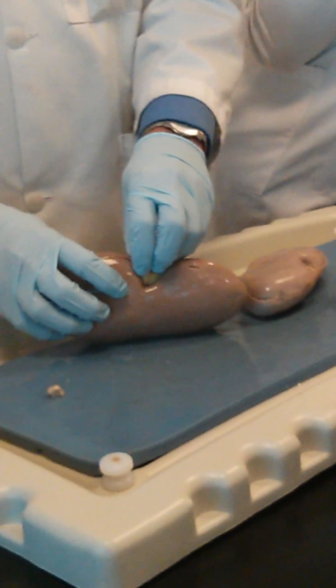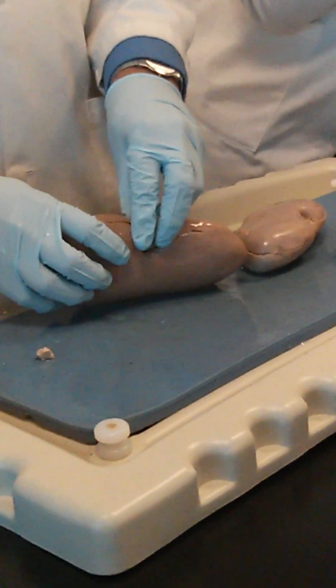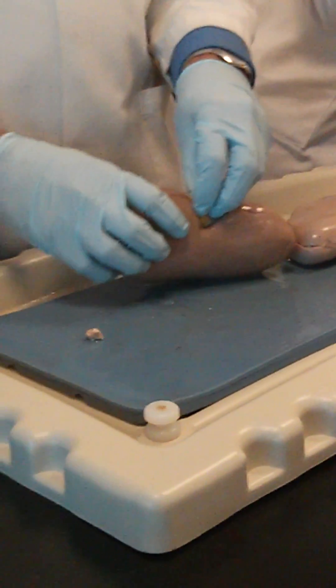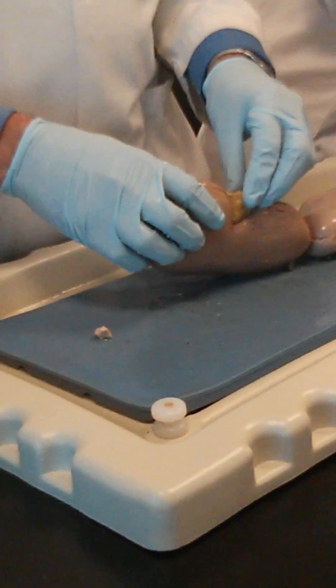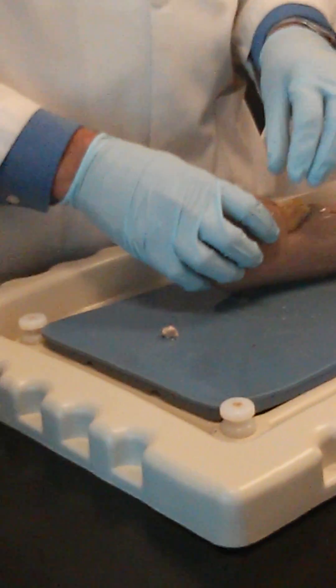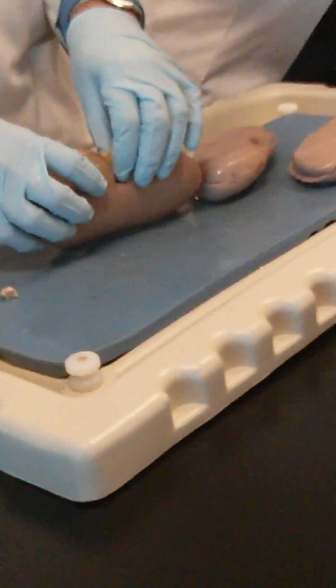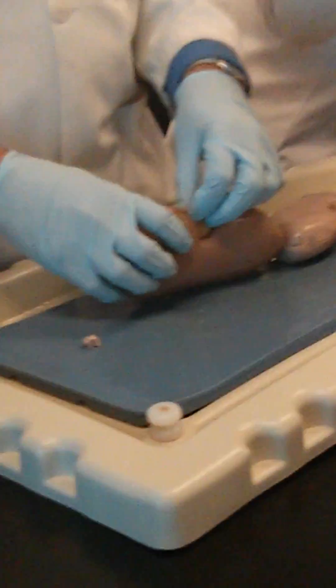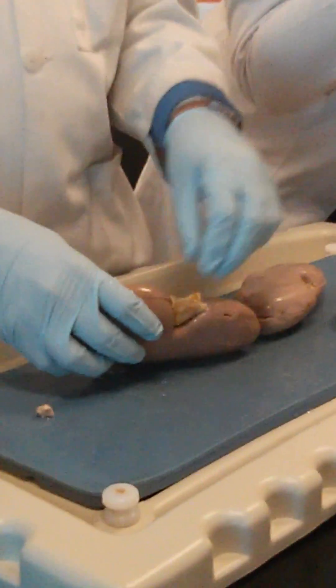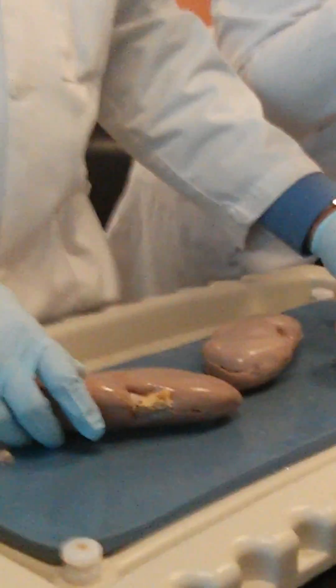The middle of the kidney is called the hilum. Three structures must pass through it: an artery, a vein, and a third structure. That is what we call the hilum of any organ. Here is the hilum of the kidney, and we are going to inspect those three structures.